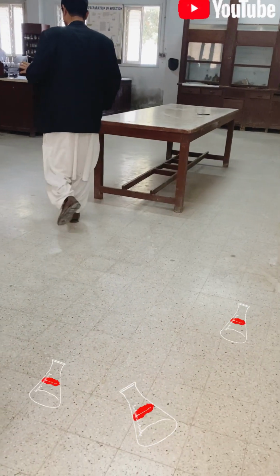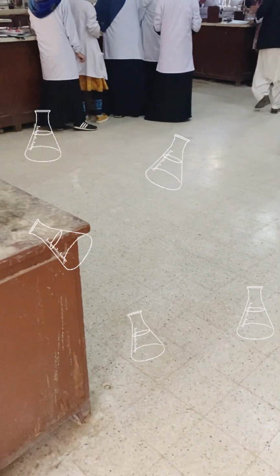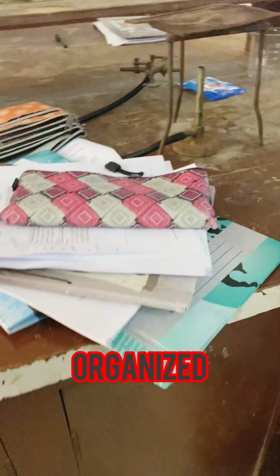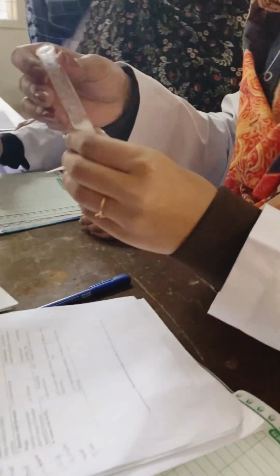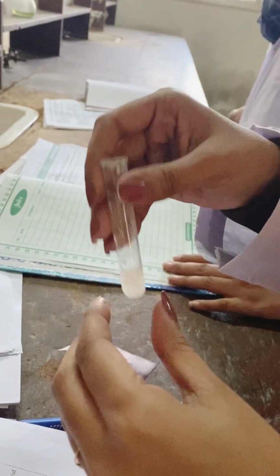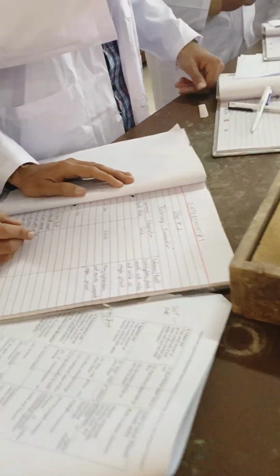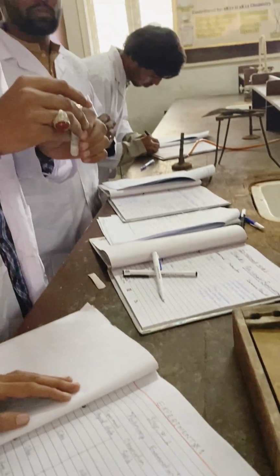This is how they are working here in the lab, the girls and the boys. I can show you how they're working. Students are working, and they're also making their journals. They're performing different tests as they are now doing their first step, that is the preliminary examination. We have these acids lying here, compounds which they are identifying. Meanwhile they are working, making the journals also.